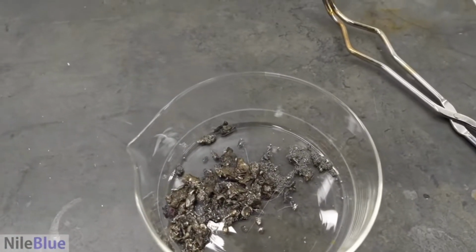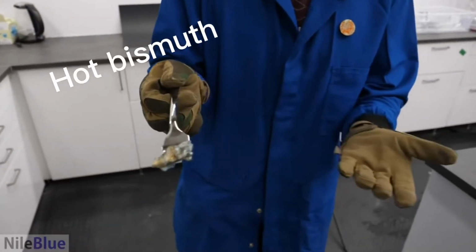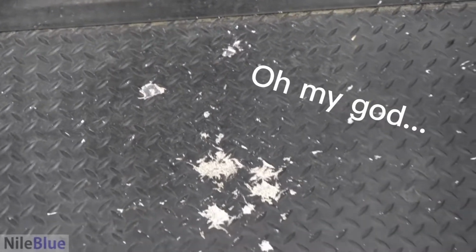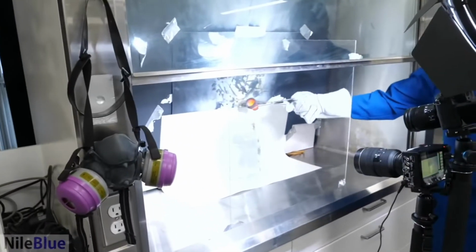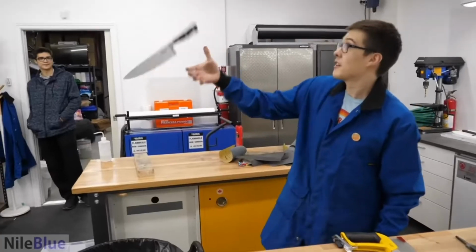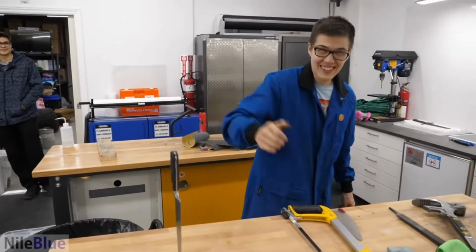Oh no! We already made something cool, we're done. Still look, good. I keep dropping little metal drops. Oh! Oh my God. One. Oh! No! Put it back, alright, that's the end.